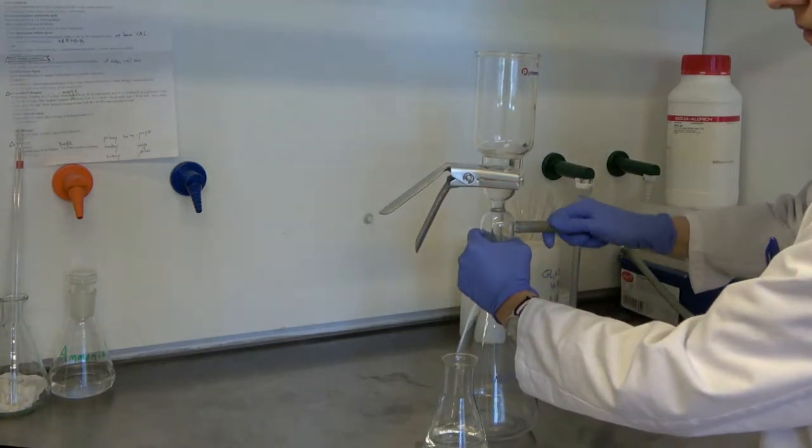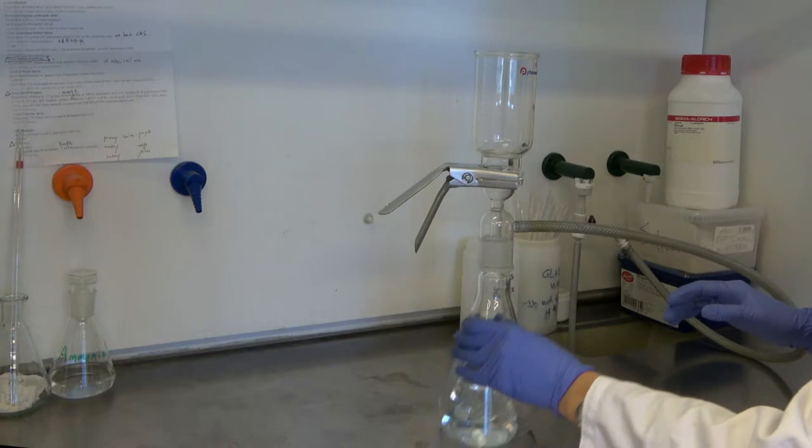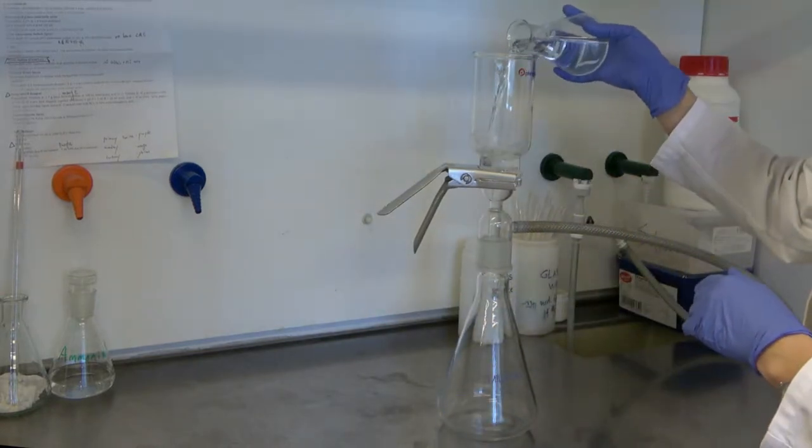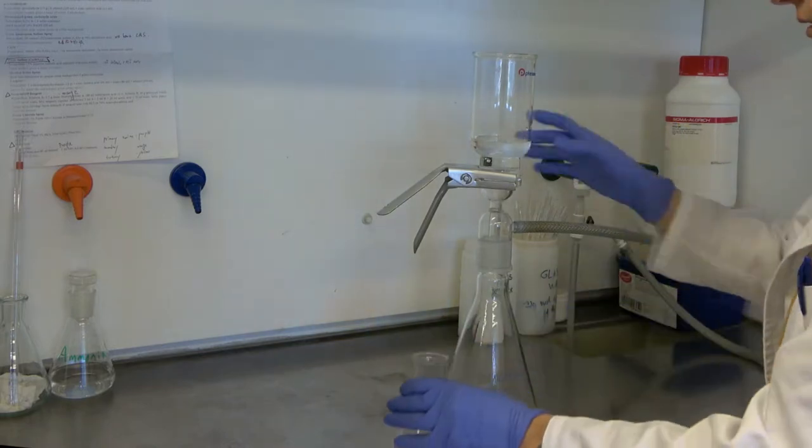Prior to using the system, it should be cleaned out using MilliQ water. The water is moved around, making sure to get the edges of the glass, and then filtered through.